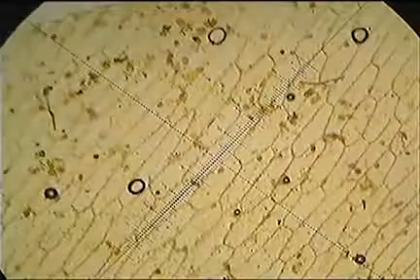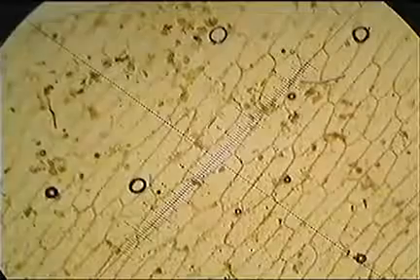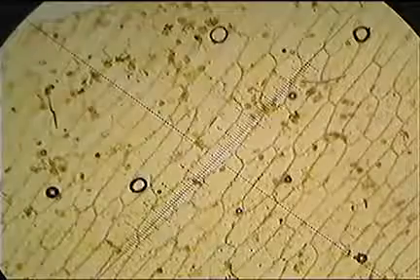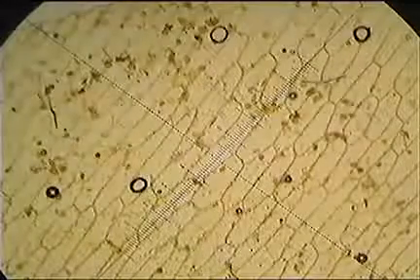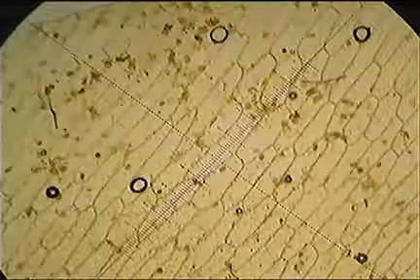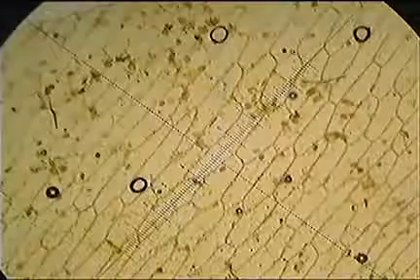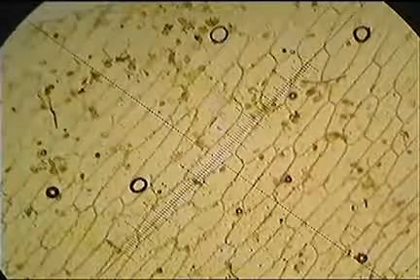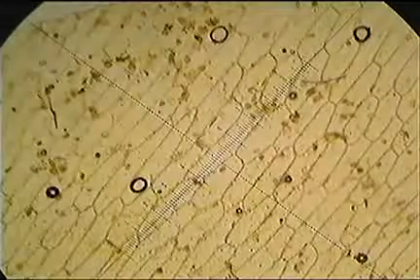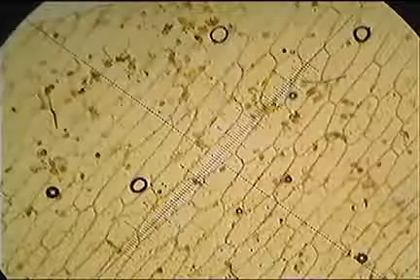So just moving it to look at another cell now. Looking at the cell just to the left of the center underneath the scale, this one's only 2.5 units across. So we could take our value, our 0.099, and multiply that by 2.5 of our eyepiece graticule units, and that would give us, rounded up, 0.25 millimeters across. So that's how we can actually measure cells.